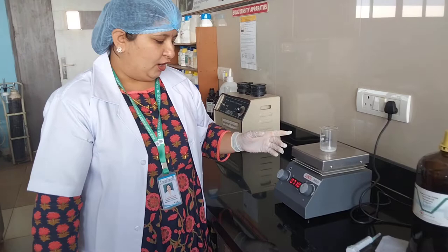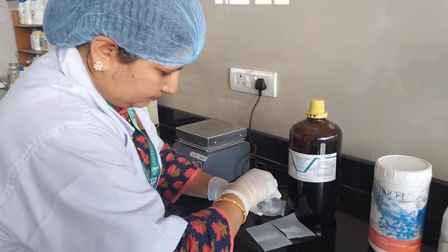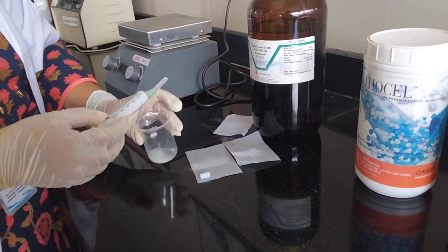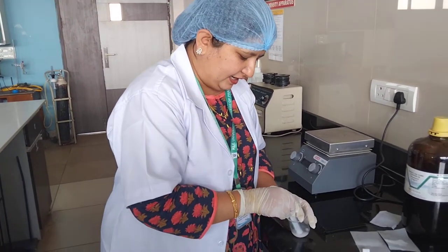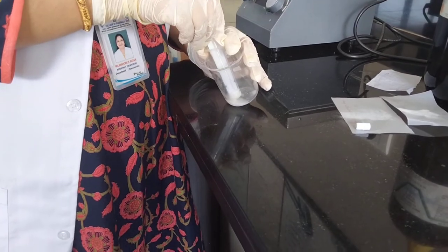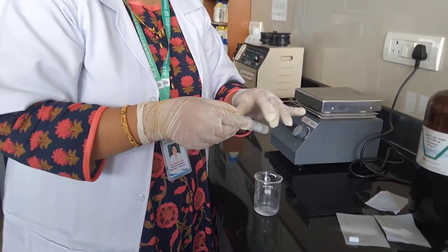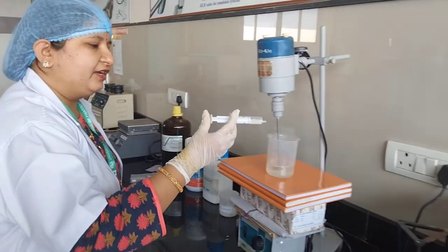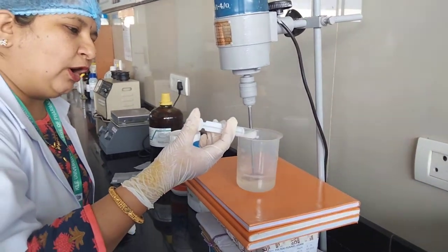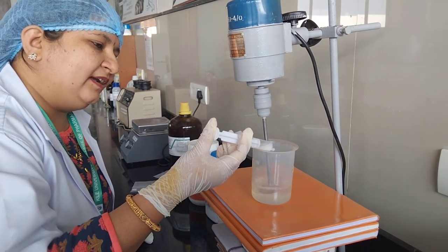When the polymer is removed from the magnetic stirrer, a syringe is used wherein the acetone along with the dissolved polymer and drug is filled into the syringe. This is done by the injection method. The acetone solvent will start evaporating as we stir the glycerol surfactant. We add the drug and polymer mixture drop by drop, and because of the high stirring speed, the acetone solvent evaporates.